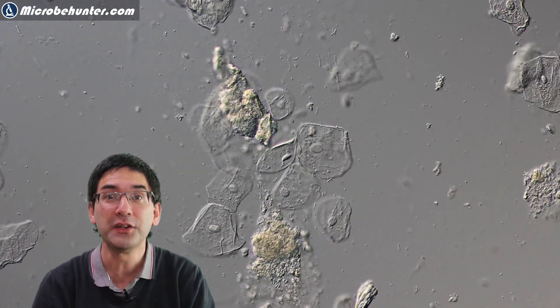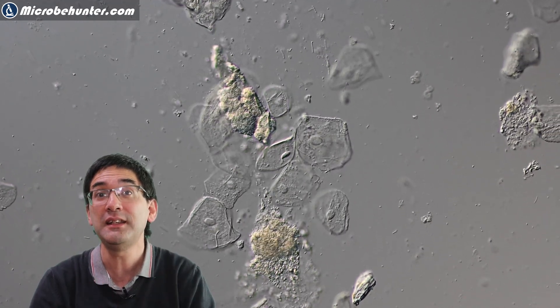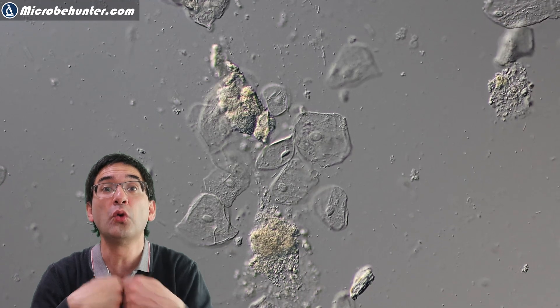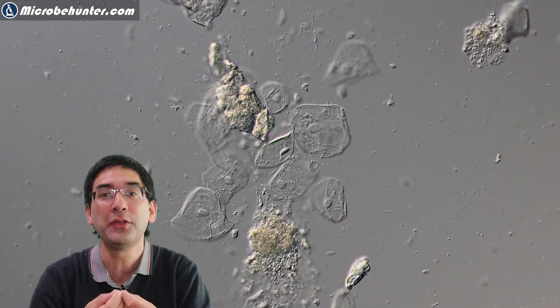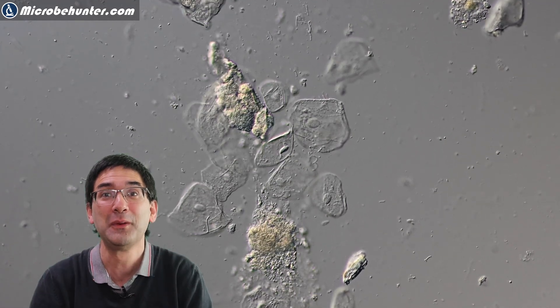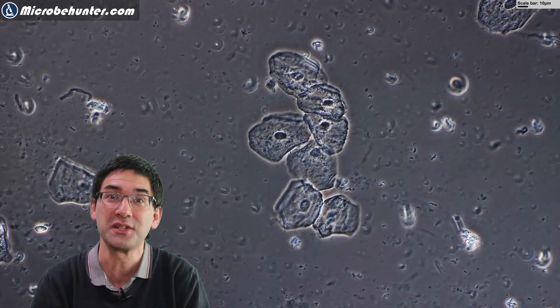And here we see them again. I also found a few other cells which were not quite as flat, but also more round. And these cells, I think, because of the strong wind of coughing, they simply were ripped along and ended up in my mouth, and then they are swallowed along with all of the dust and dirt that also gets caught inside the mucus.